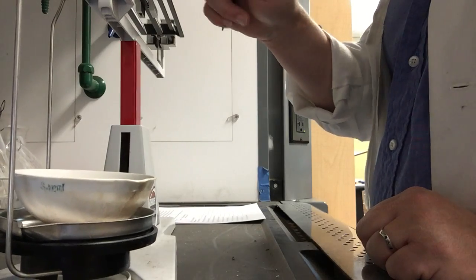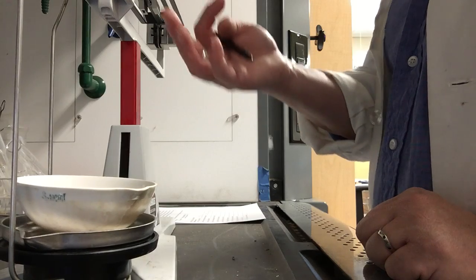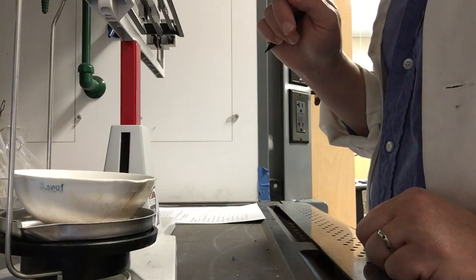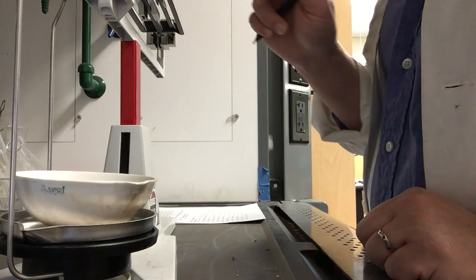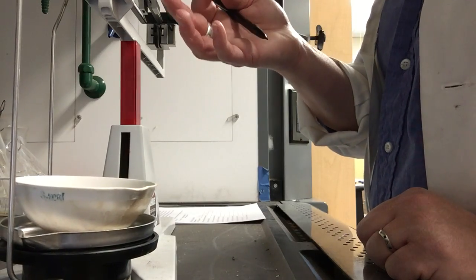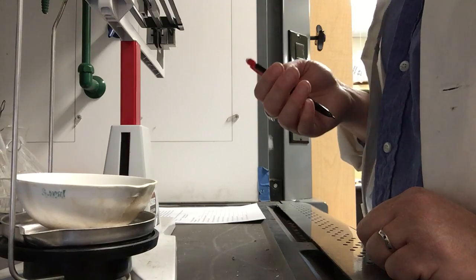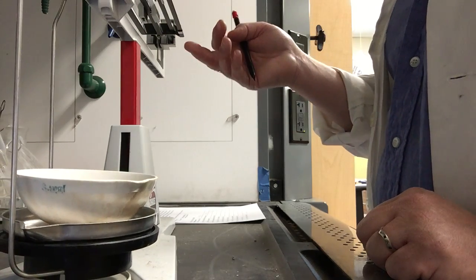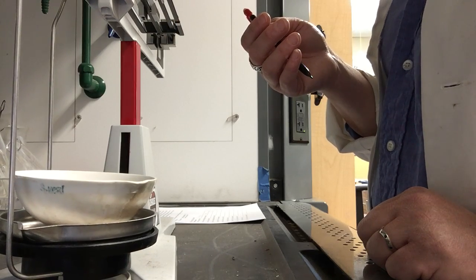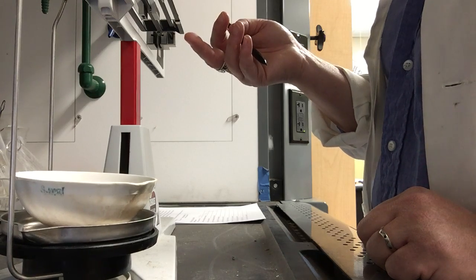So I'm going to drop all my counters back, and it looks like we're still over 60, less than 66, less than 65, more than 64. Okay. So I'll start moving it out to the 0.95, 0.8. We're getting there. We're in the ballpark. It's getting close to balancing.